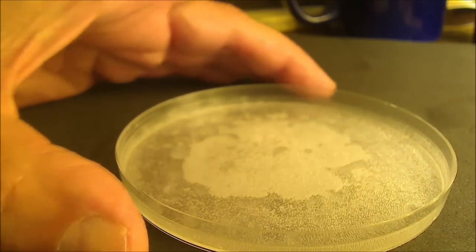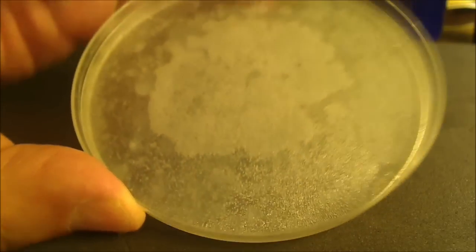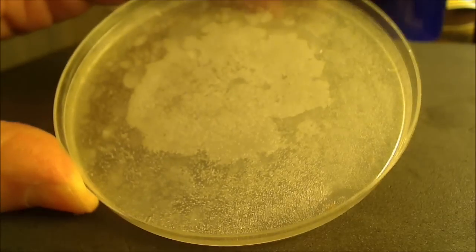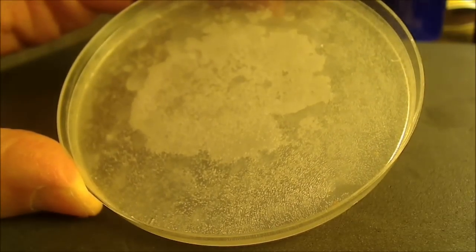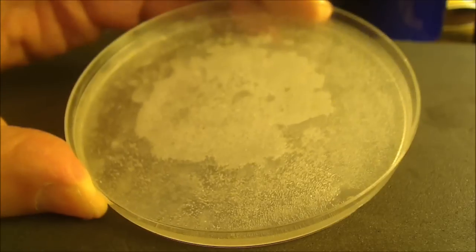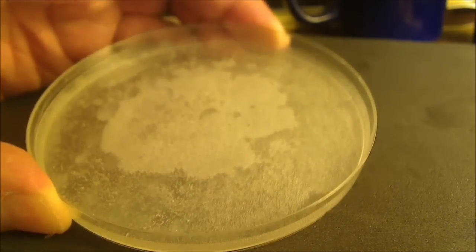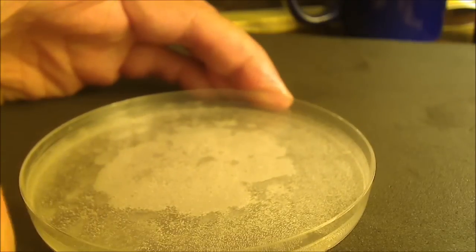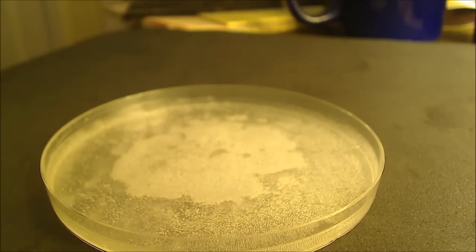Okay, I think you can see that the solvent has pretty much completely evaporated, and you can see the crystals of paradichlorobenzene, and I can smell the characteristic aroma of the mothballs.